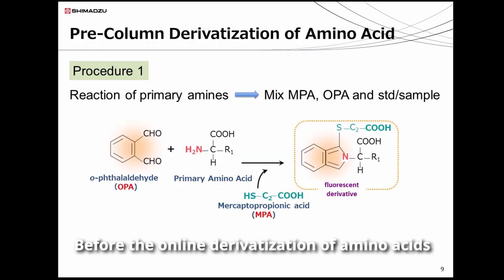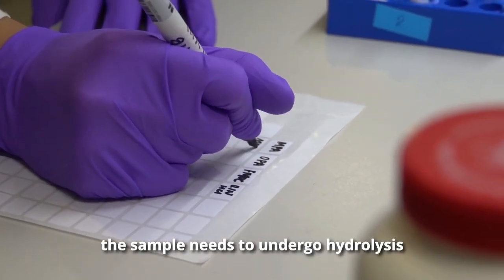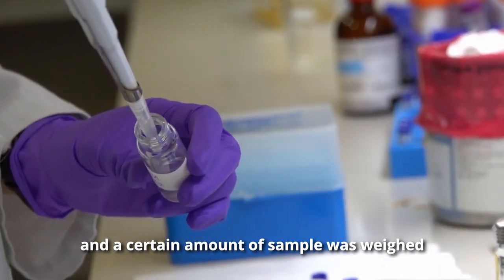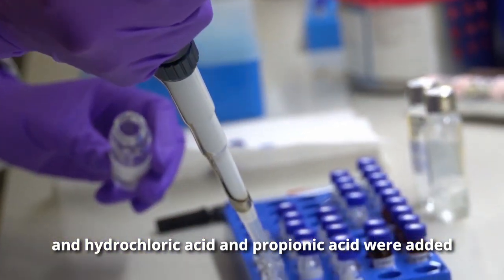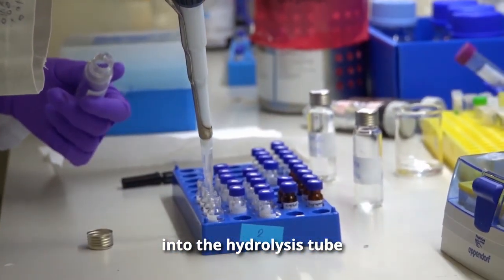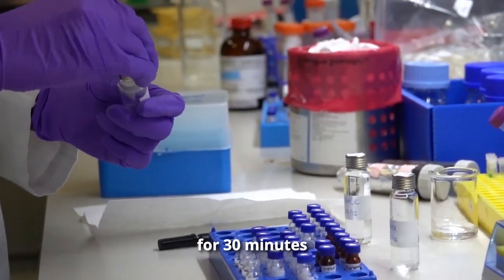Before the online derivatization of amino acids, the sample needs to undergo hydrolysis. A certain amount of sample was weighed into a hydrolysis tube, and hydrochloric acid and propionic acid were added into the hydrolysis tube. Then the sample is heated at high temperature for 30 minutes.